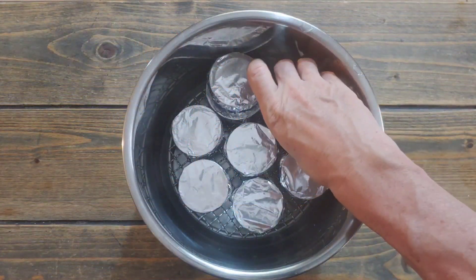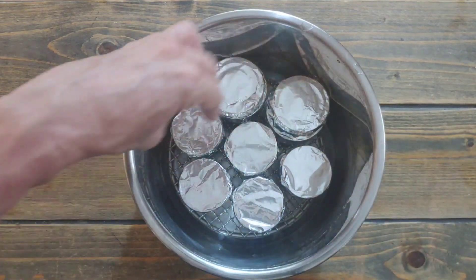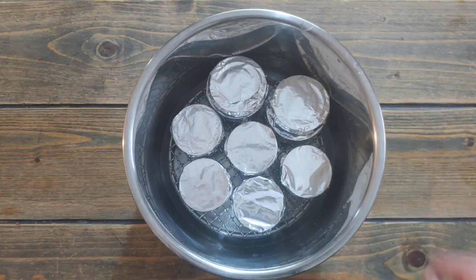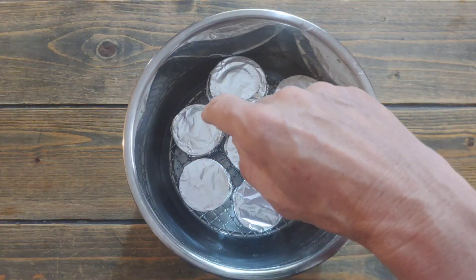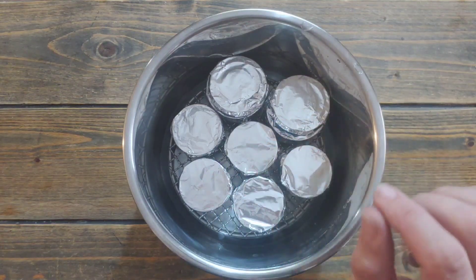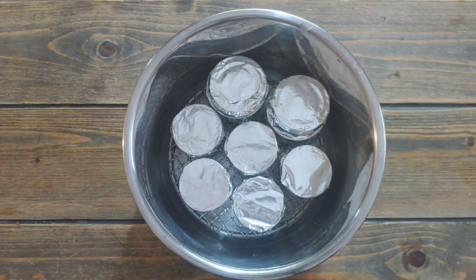I put the large PP5 cups on the bottom, kept the cheap thin plastic ones on top, and the other PP5 cups in between. We'll see who survives. We know the large ones are going to survive because I do that all the time. The thicker plastic ones should also survive — they're PP5 and not as thick, but they should be fine. The ketchup cups I'm predicting are going to melt. We'll see — we might get lucky. This is why we experiment.